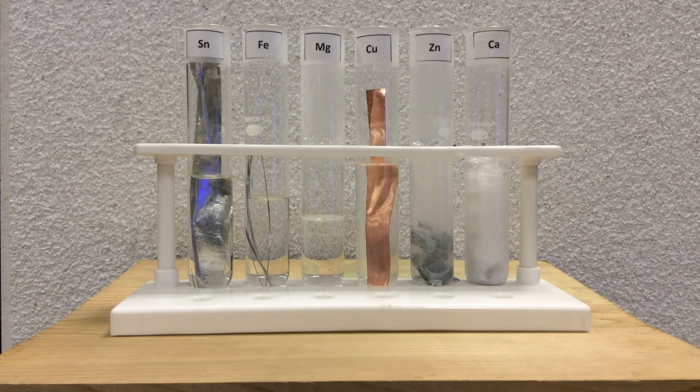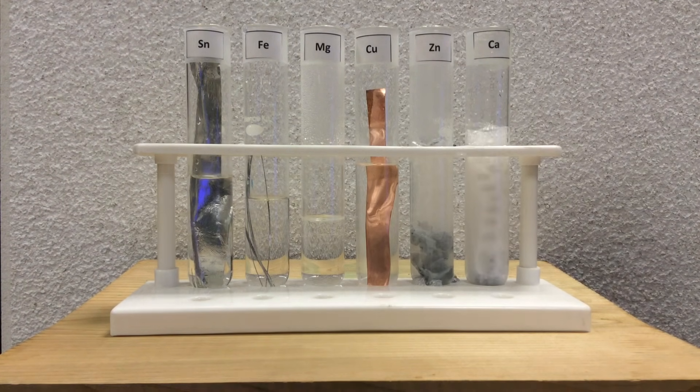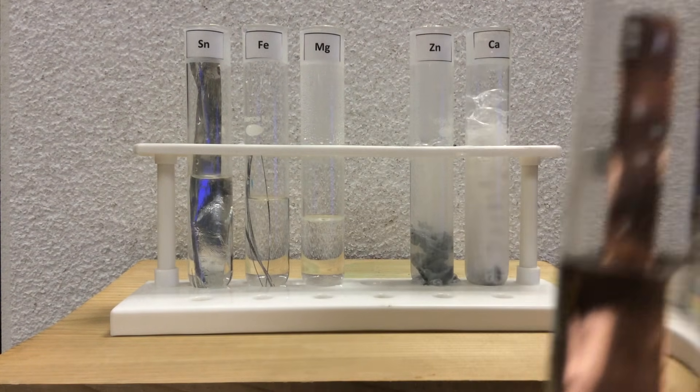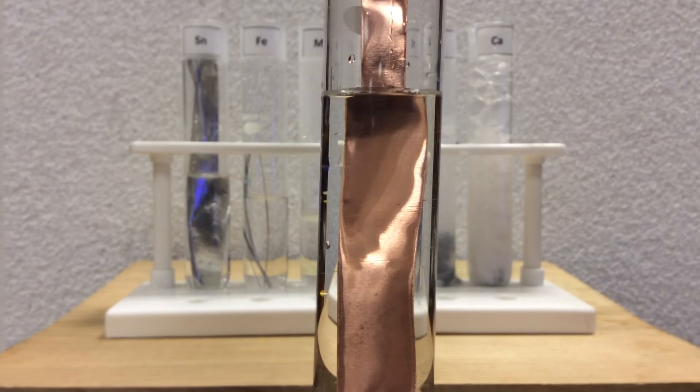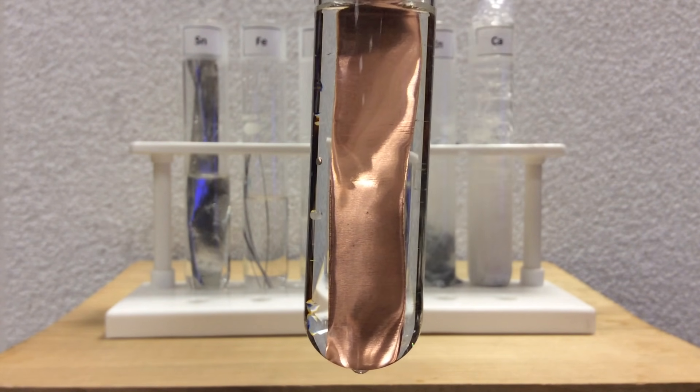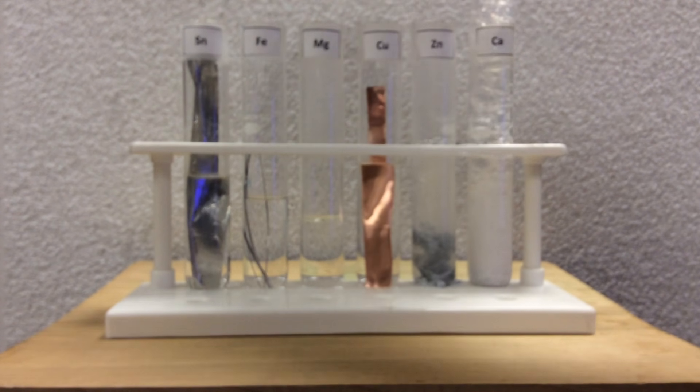So we're going to look up close and personal at these to see if the ones that aren't as reactive have some bubbles. So here comes some copper into view. And if we look up close, I'm going to change the zoom. Here we go. We can see not much going on, if anything. I don't see any visible signs of a reaction going on.